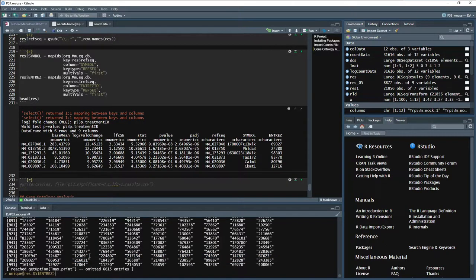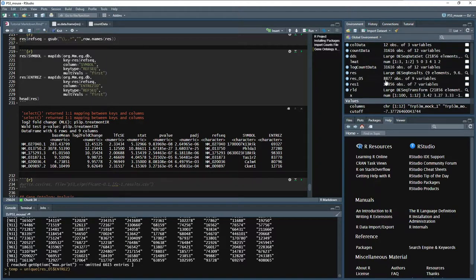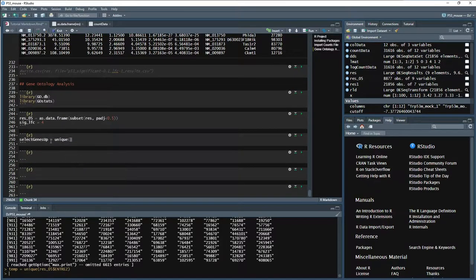Let's do this. Okay, so we have 7615 unique Entrez IDs for our 8877 entries into our significant table. So that's something that we have to consider. We want only the unique ones.